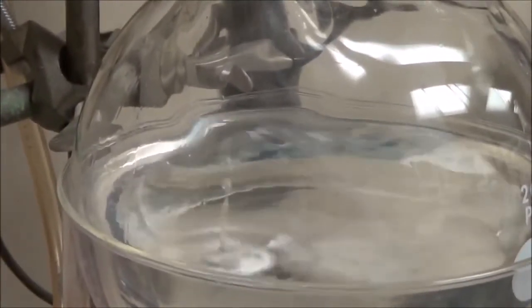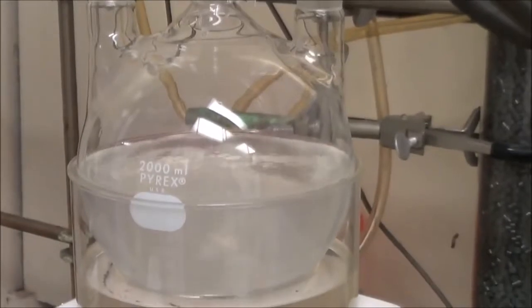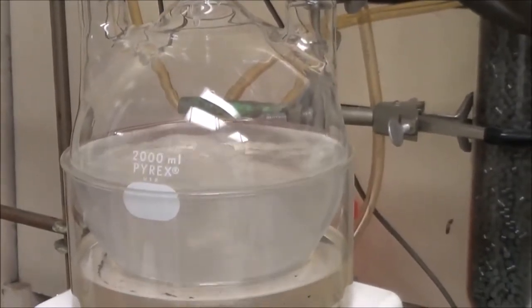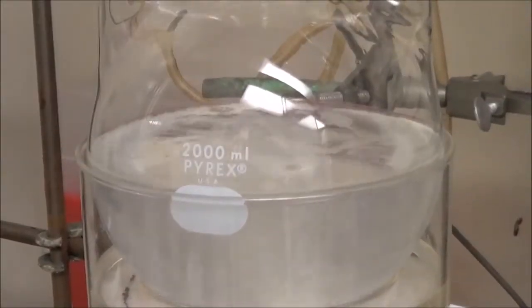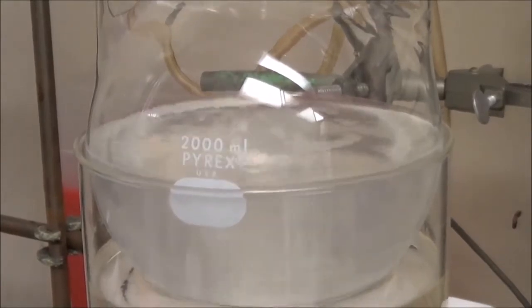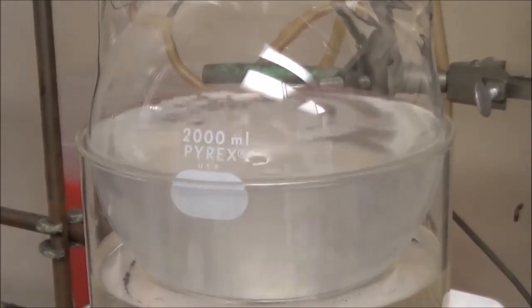You see the dibutyl phosphite dripping into the hexane with sodium. After a little bit of time, you can see that the sodium is starting to react. It's reacting a little bit more. You see that the hexane is refluxing, but moderately so.